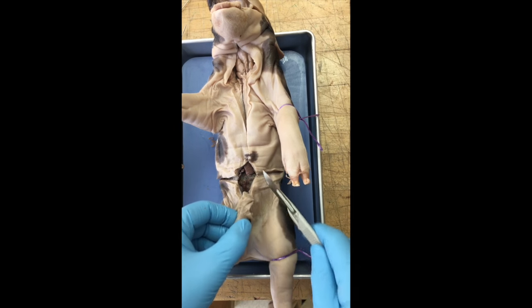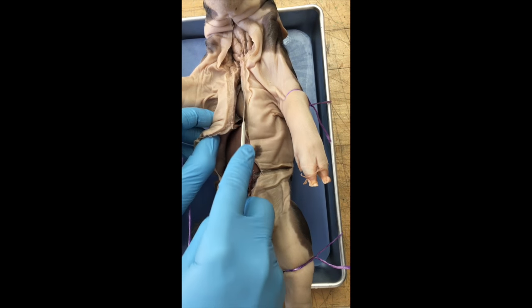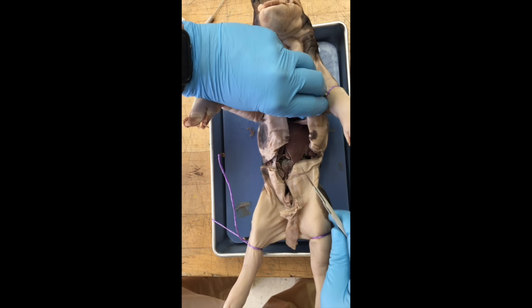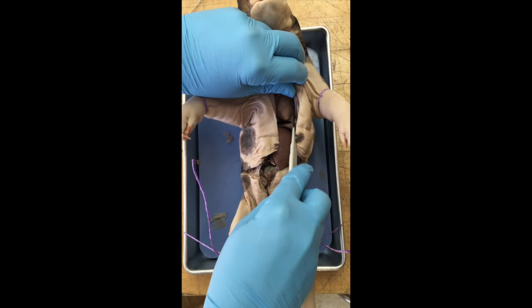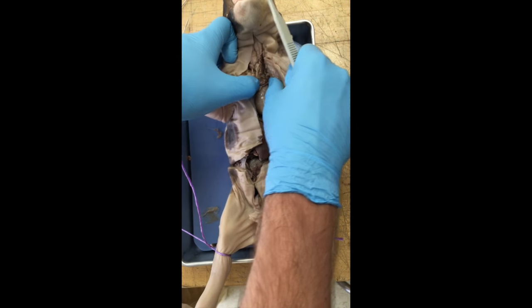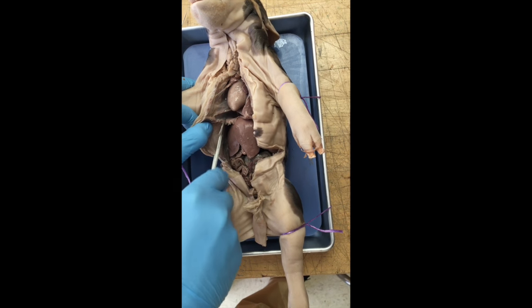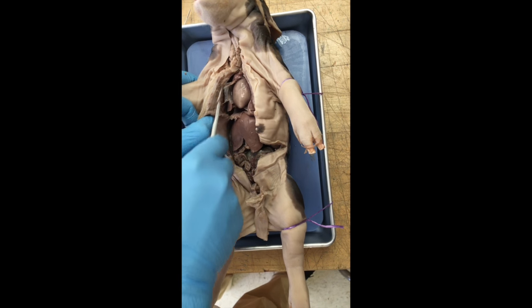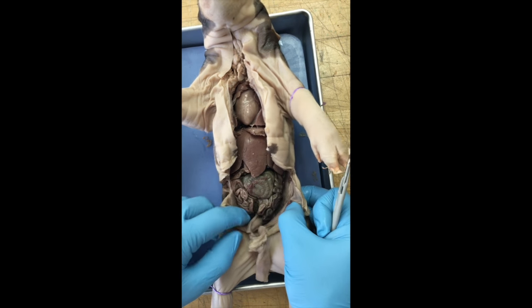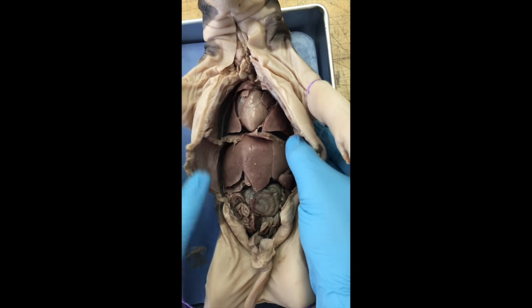You can see that you should be able to pull the umbilical cord out of the way and your organs will start becoming exposed. Lift up with your hand and start splitting with your fingers. The diaphragm is what's holding it together — it separates the lower organs from the heart and lungs above. Go very gently and cut the diaphragm so the pig will open up to expose the organs. If you do it correctly, your pig should look like this and you can see all your organs above and below the diaphragm.